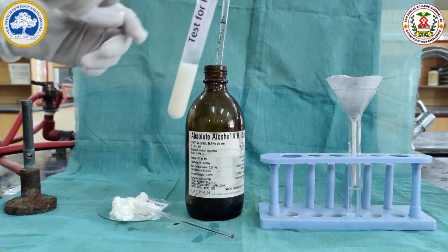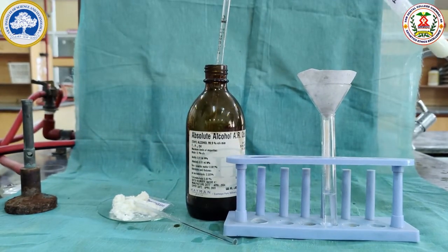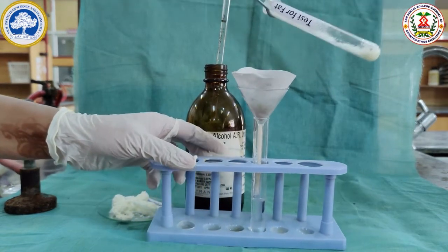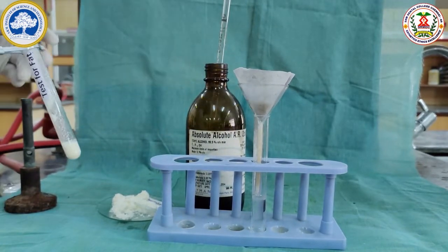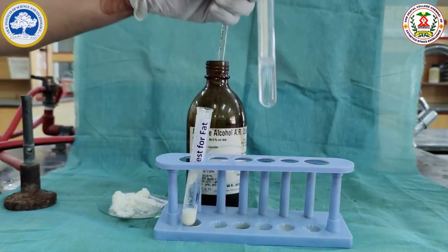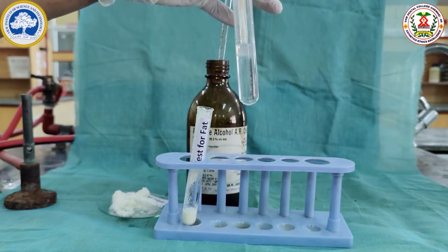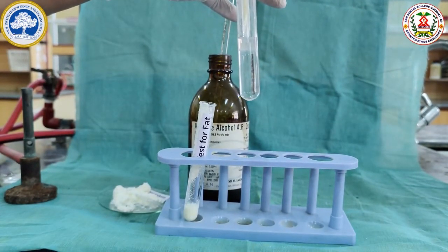It is slightly warmed to release the fat from the precipitate. Then we are going to filter it in distilled water. This test tube contains water. When we add the fat-containing sample, we can see the emulsion formation. The fat released from the sample is forming an oil-in-water emulsion. This shows milk is rich in fat — the precipitate contains fat.